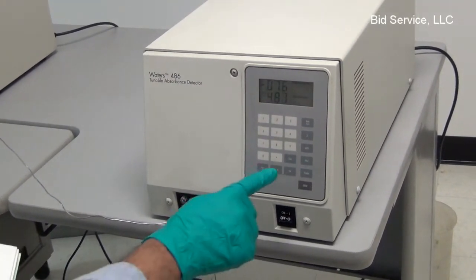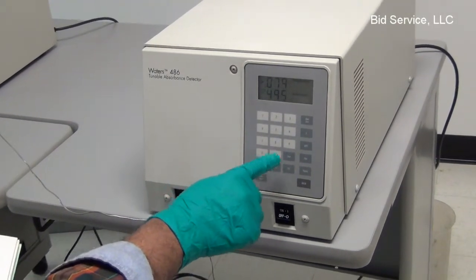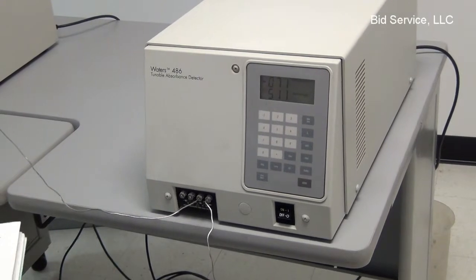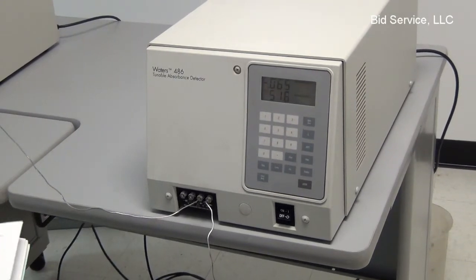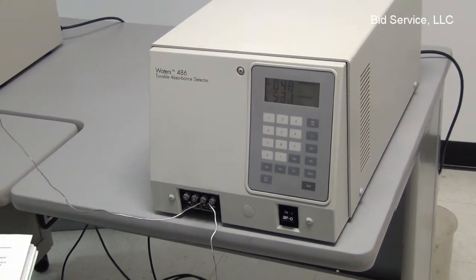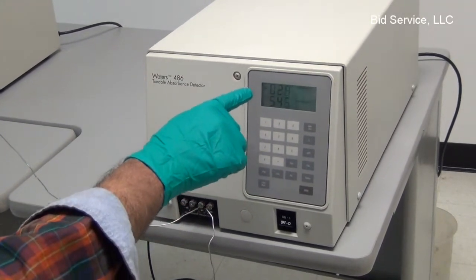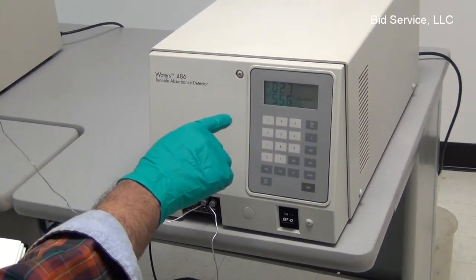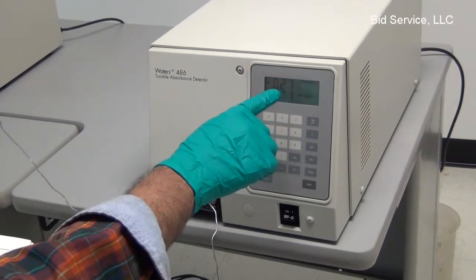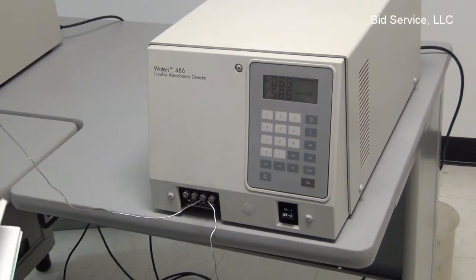At any point in time, if any data is to be cleared or changed, the clear button can be used. And to adjust the displayed absorbance units, transmission units, or sample energy level to zero, the auto-zero function can be used.